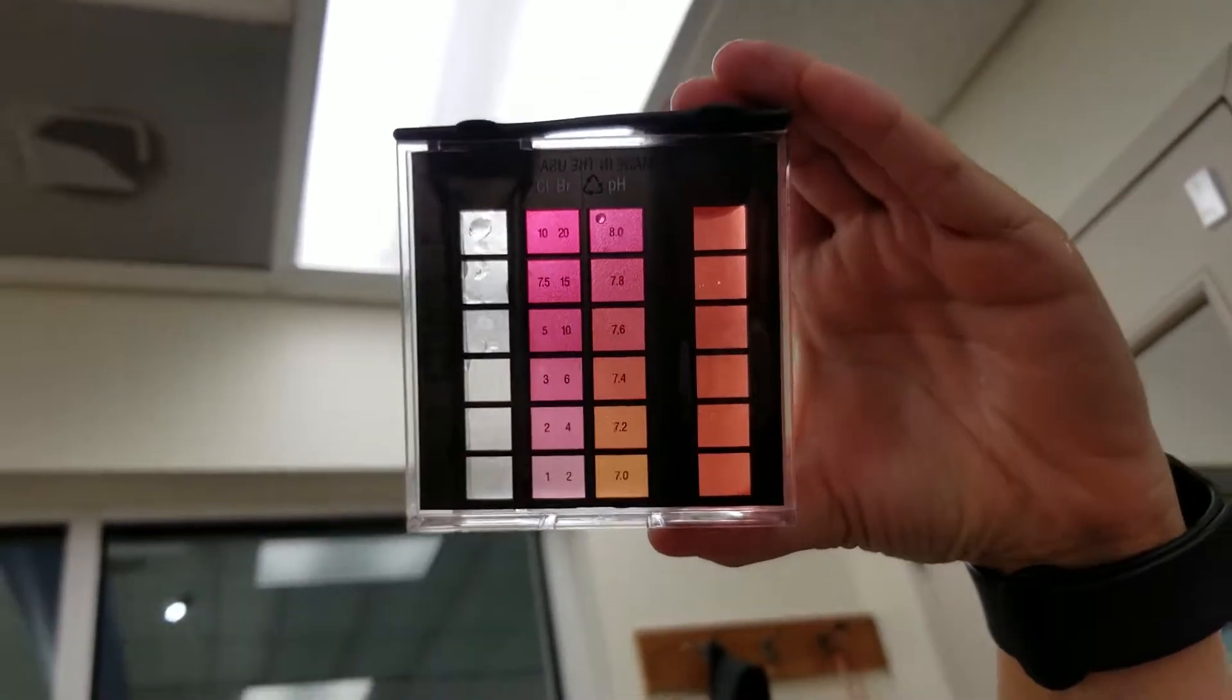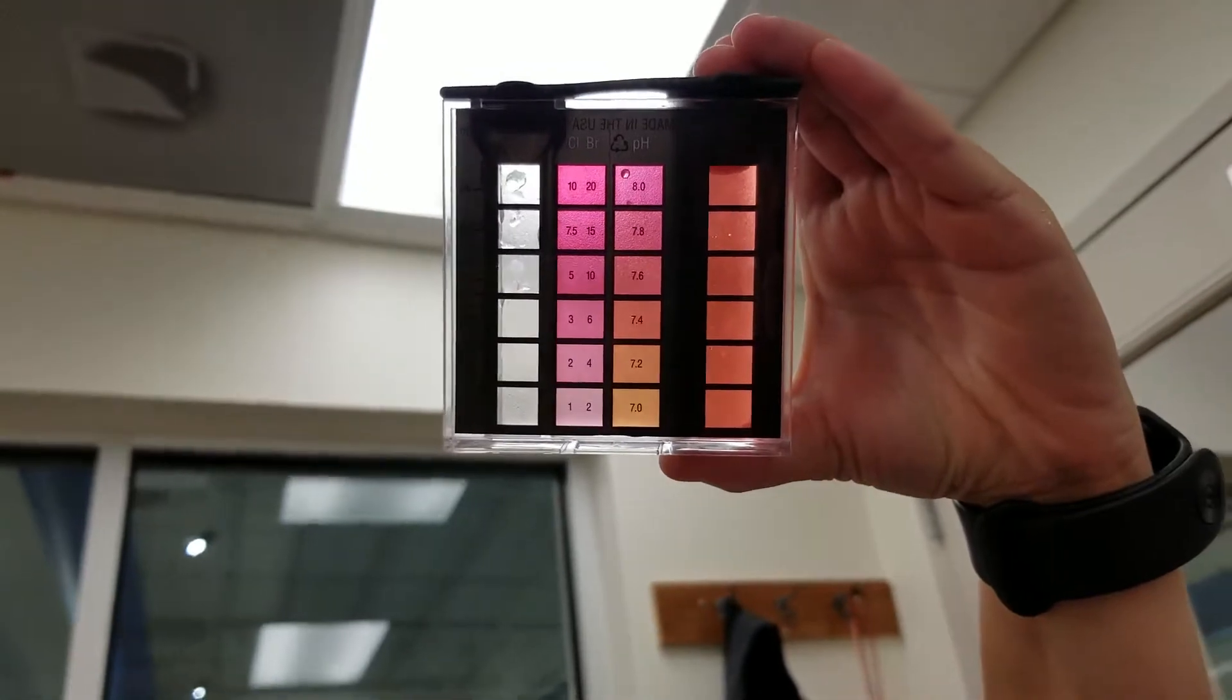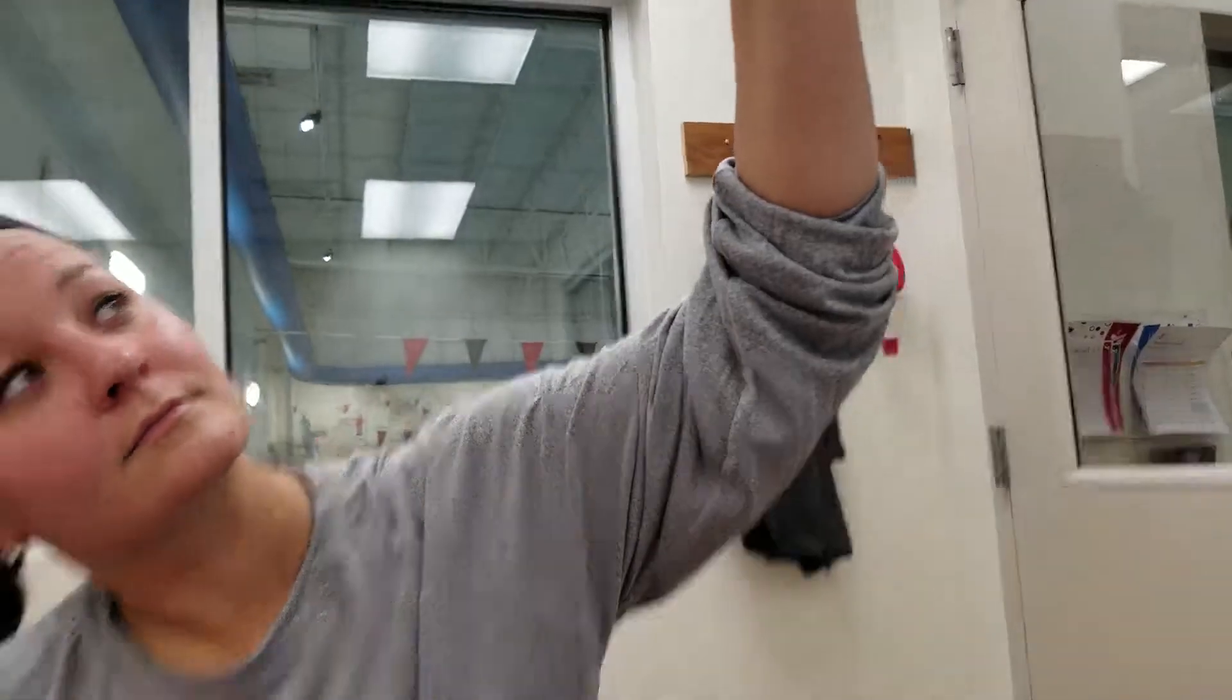That is a pretty good 7.4 if you match the water sample with that 7.4 in that column there.